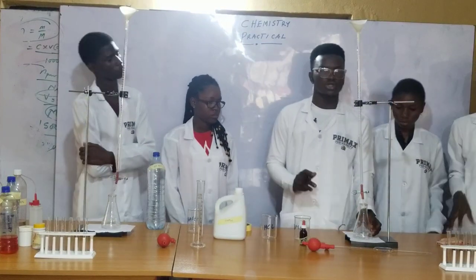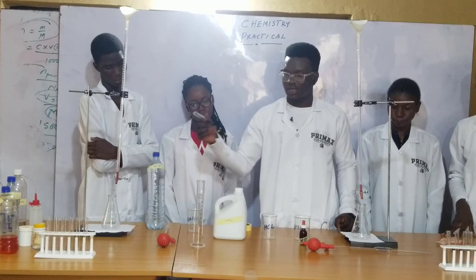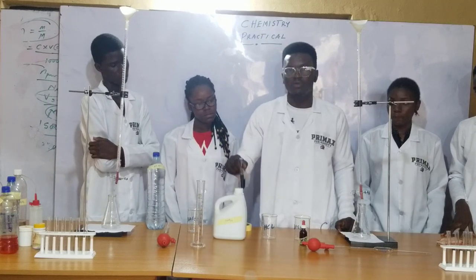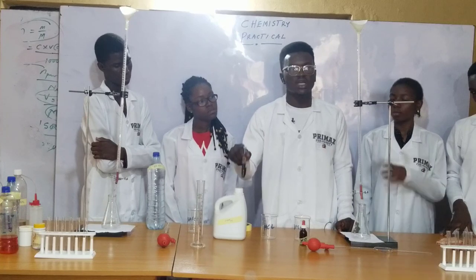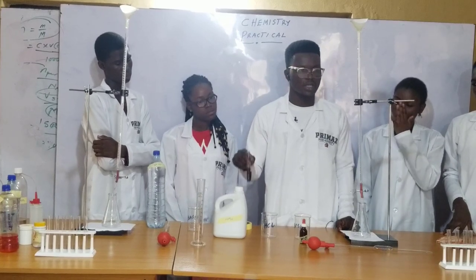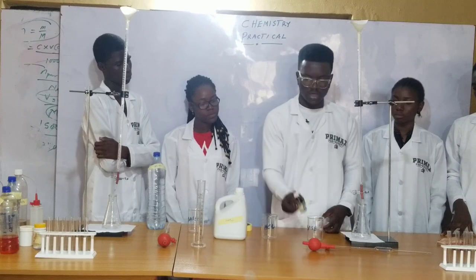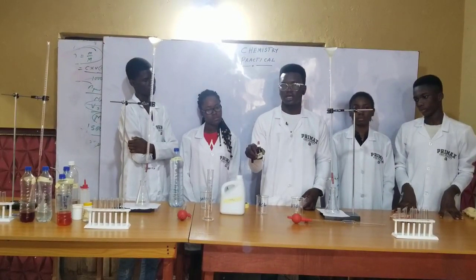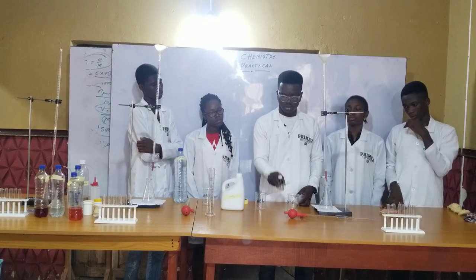We'll be carrying out this titration in order to know the volume of acid that will exactly neutralize a particular volume of the base at the equivalence point or the end point. At the end point, we are going to see a color change. Our indicator for this experiment is methyl orange.